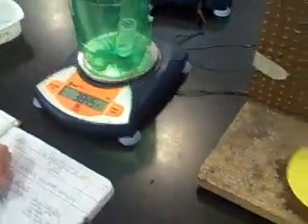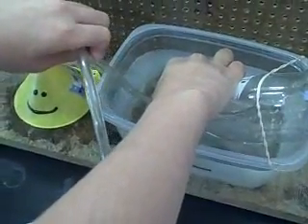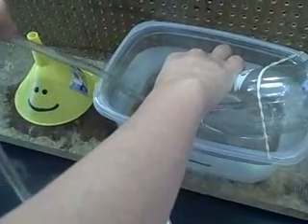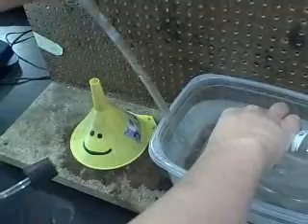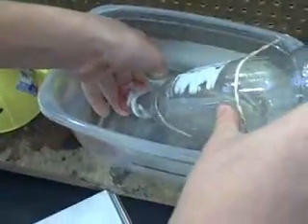Did you have a loss in mass? As Jason is finishing writing it down, what he'll do is take the bottle out, first pulling the tube out very slowly without disturbing it. Now he pulled out the tube, and he's going to put the plastic on the bottle so the gas won't escape.